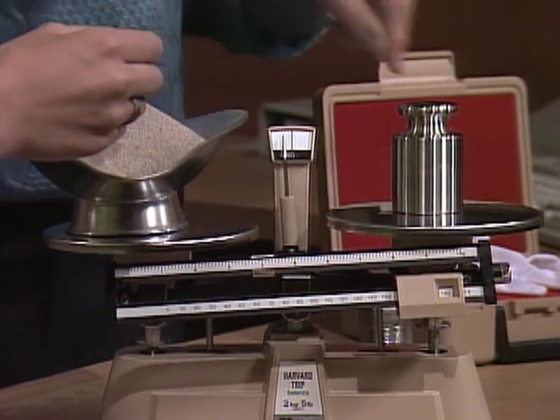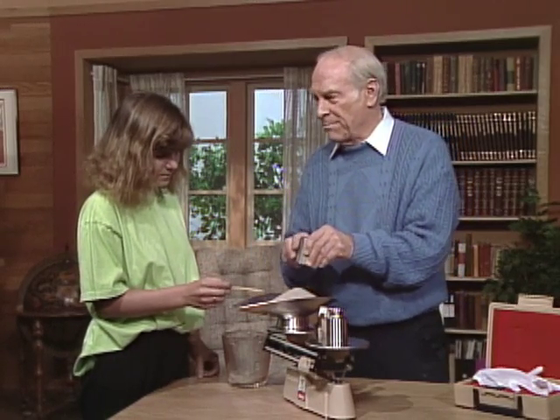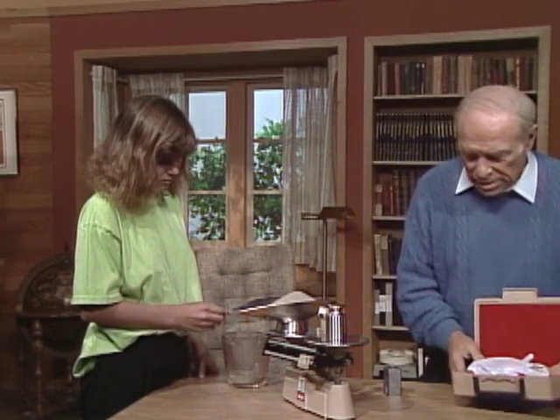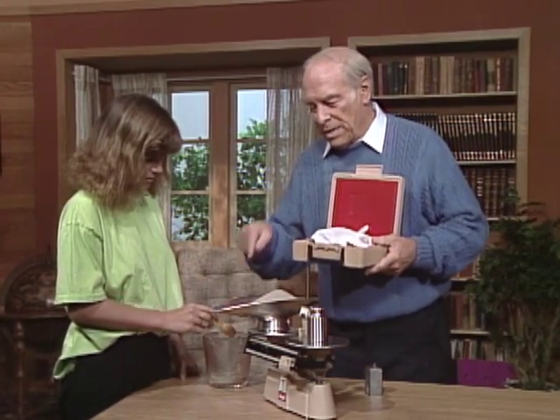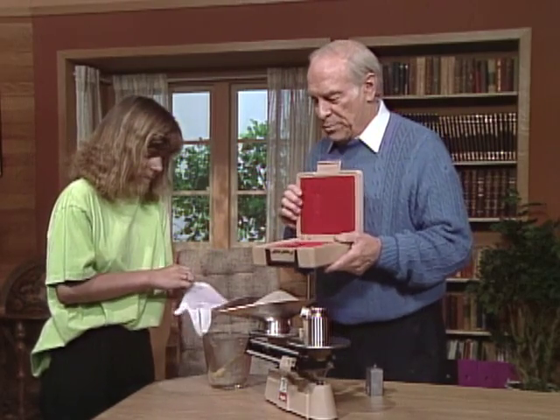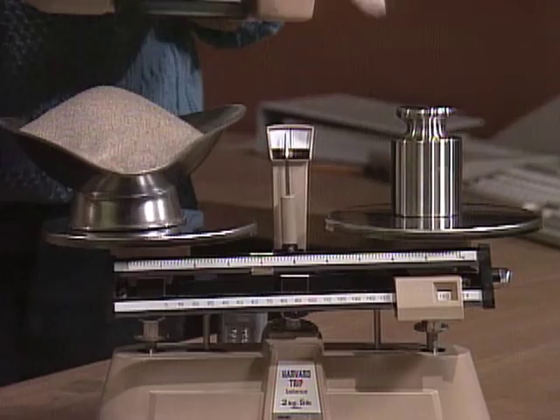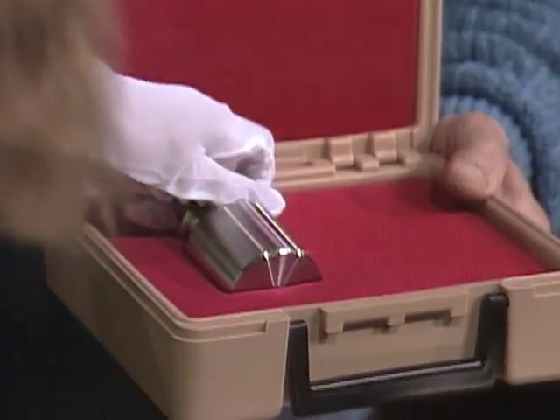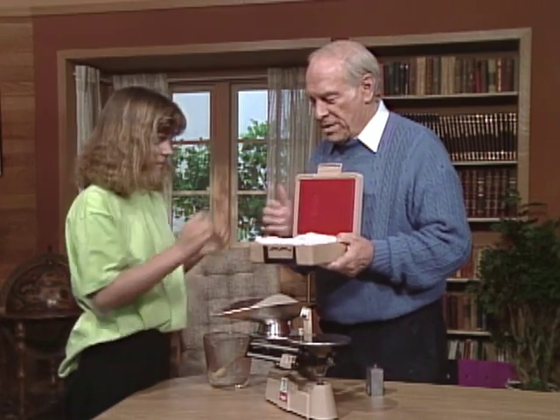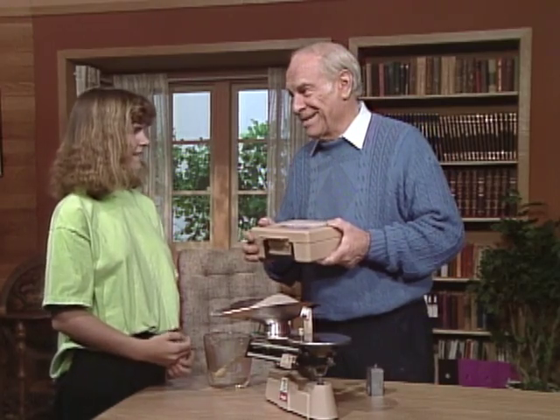Actually, when scientists do this they'd be weighing the weight and adding or subtracting weight from the other side to make it match completely. Now, to make sure it doesn't get contaminated, put on the glove and put the weight back into its special box. And now you can tell the kids in class that you weighed out exactly one thousand grams!